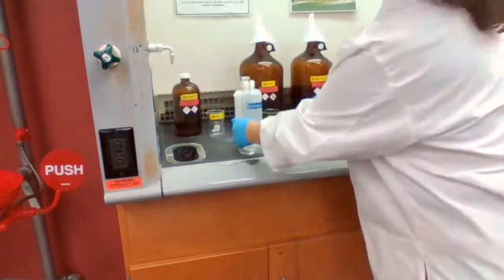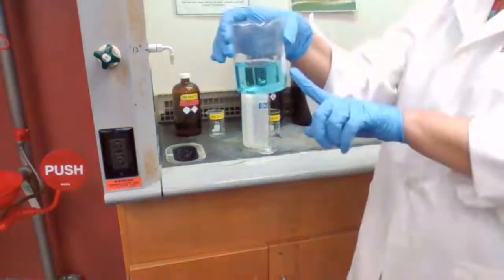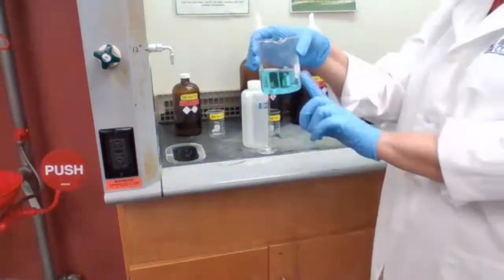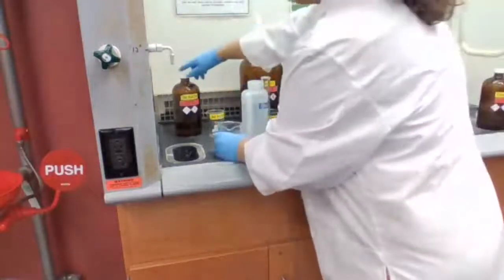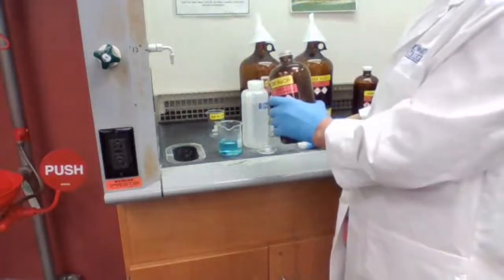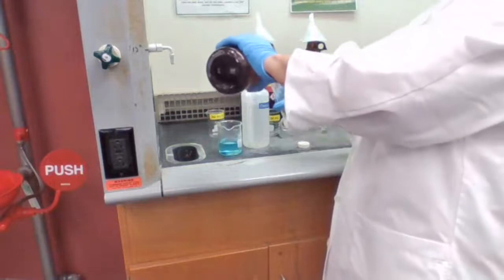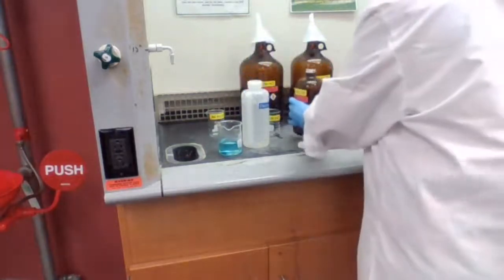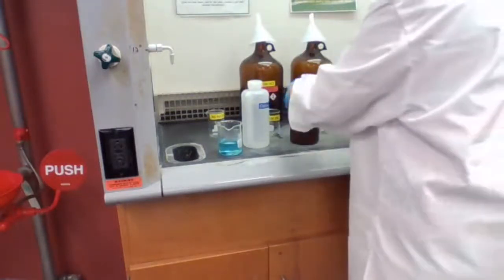The brown gas is gone, so I can now show it to you. Blue color solution. We had copper plus nitric acid. That gives this blue color solution. It's all clear. Next step, we are adding 30 milliliters of 3 molar sodium hydroxide. And I want you to record the observation, what is happening.